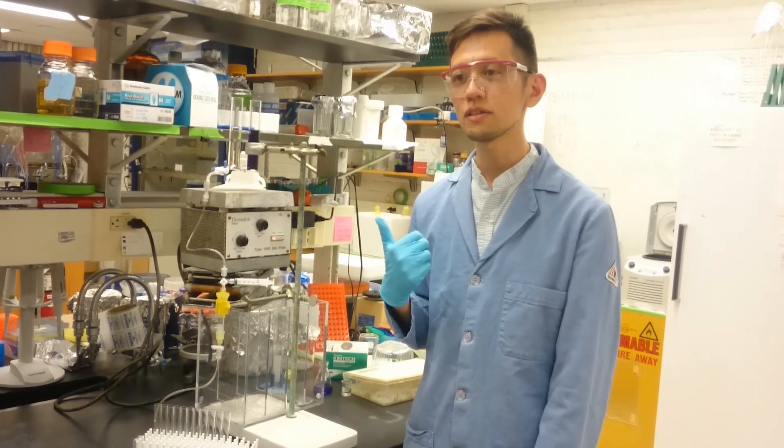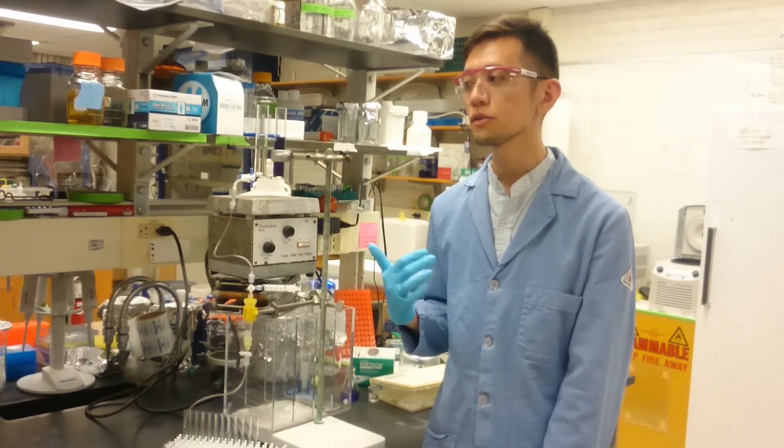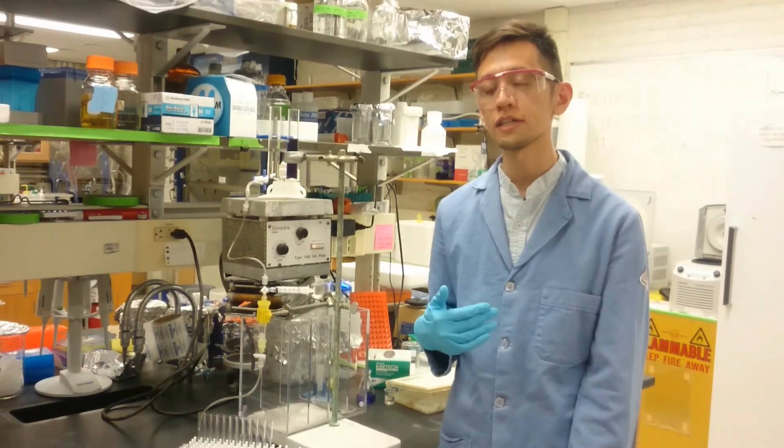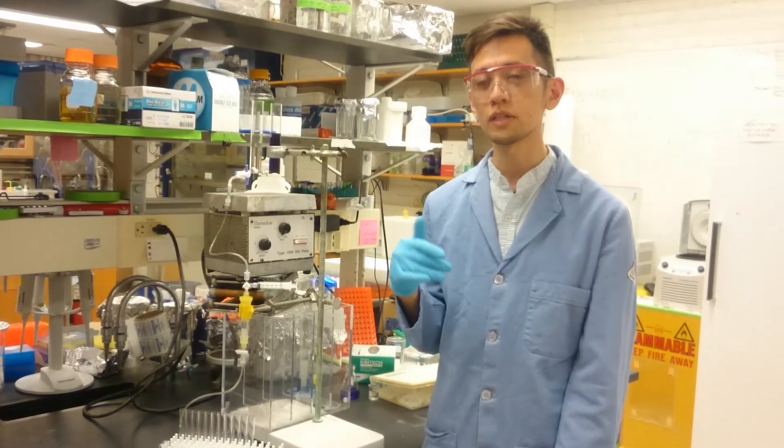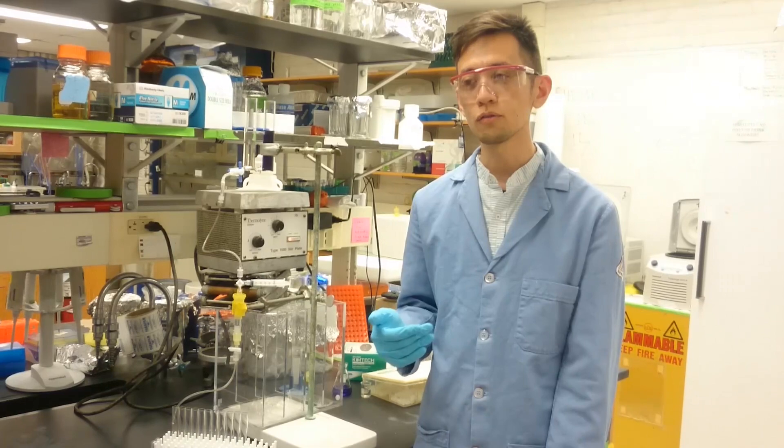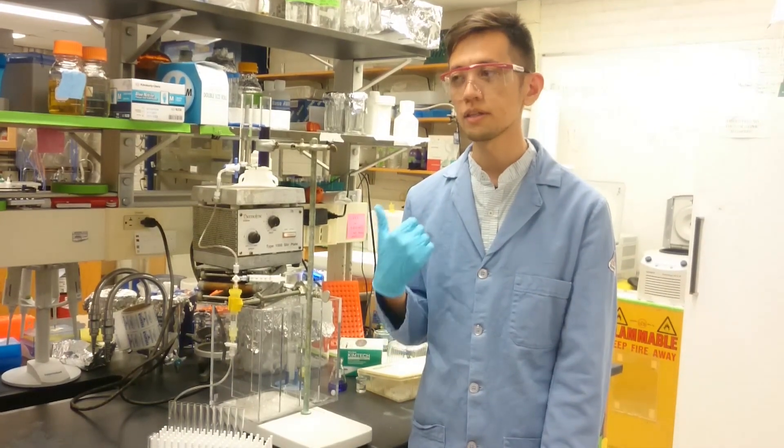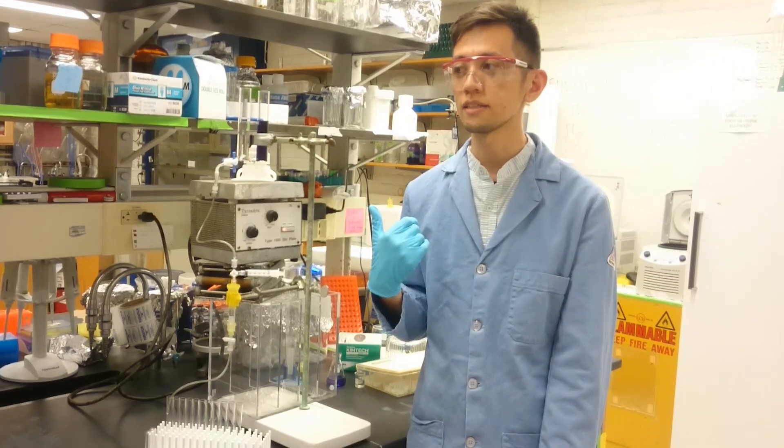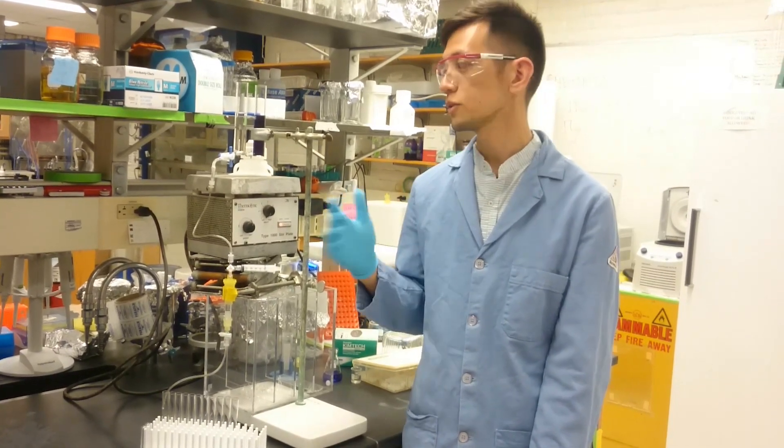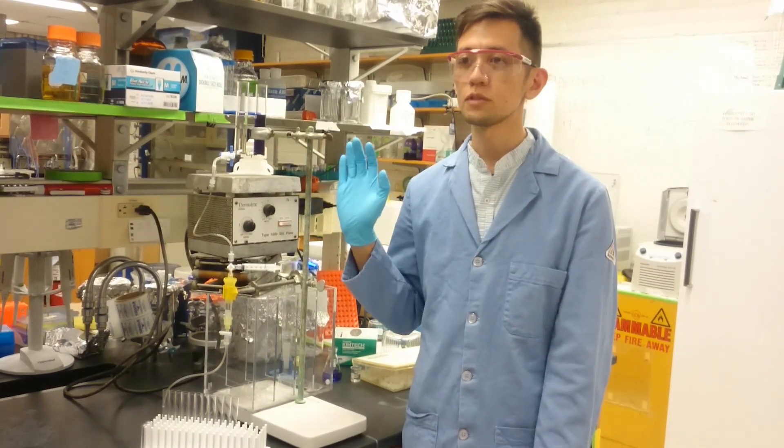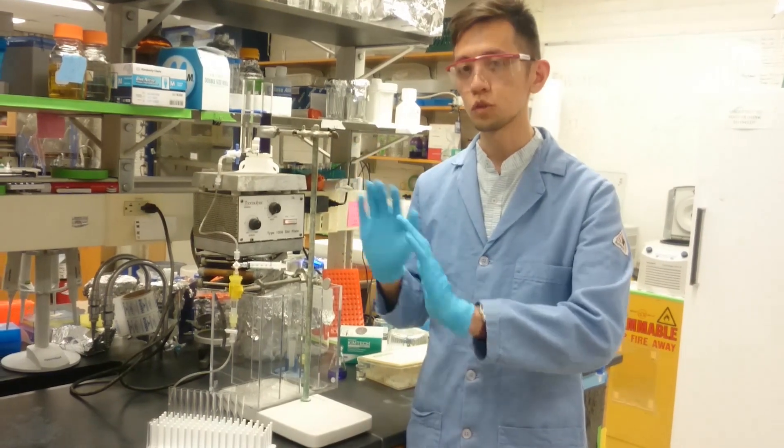Now I'm going to show you how to use a gradient mixer. In general, if you're doing protein purification, oftentimes a step gradient will give you a cleaner elution profile, but often running a linear gradient will work just as well in some cases, and it's a lot easier once you get the setup to just set it up and then let it do its thing.